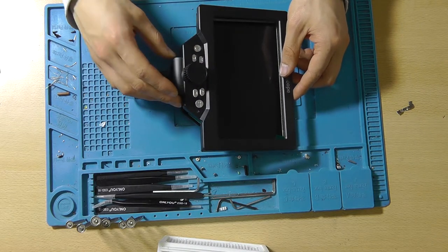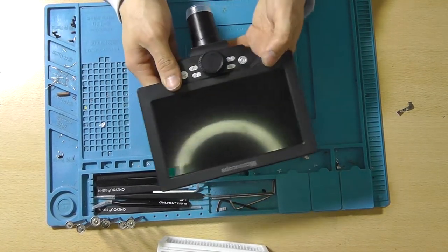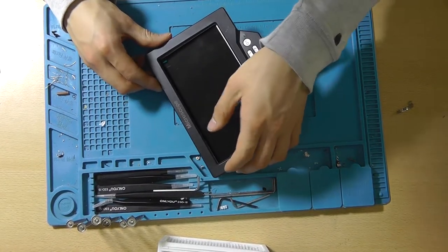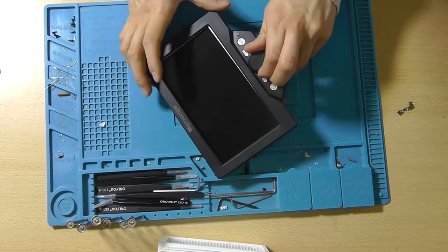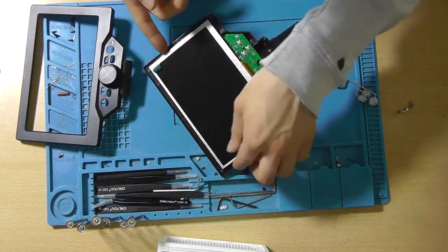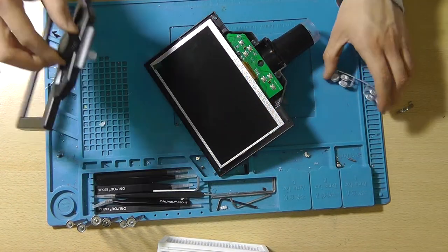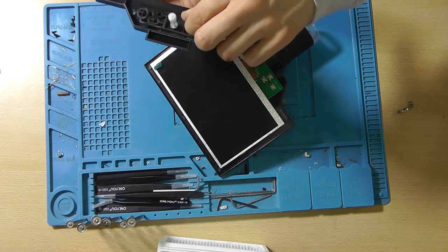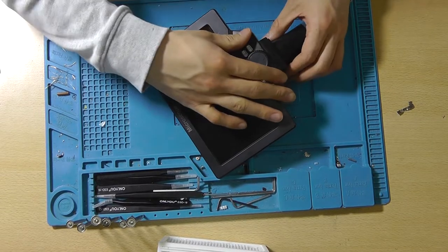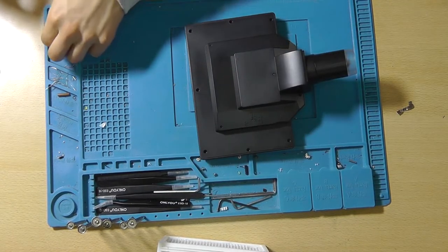Let's install the bezel again, the front panel. And let's test the focus range. I suppose that the focus range is at its max right now, as in all the way extended. Yes, it is. You are able to feel it a little bit, but it's not that you have the feeling that you're about to break something. So that's exactly what I want. Yeah, this feels really good. This feels fine. Let's screw this thing back together.